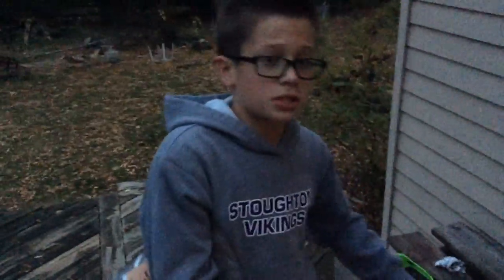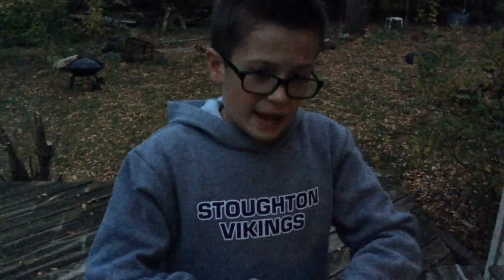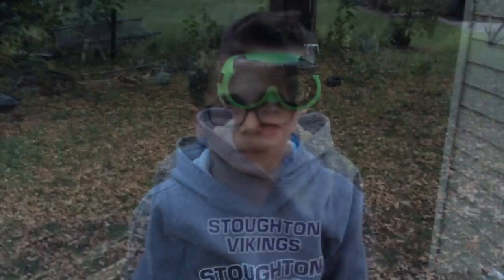And then if you didn't know this, iron in its natural state is red, even though like cast iron you see is like silver. Because as you can see, it's completely red, because the bag is coated with it. So I'm going to make a composition for my reaction, and then I'm going to put a magnesium strip in it, because that's the amount of heat I need to debond the atoms, because that burns at about 3,000 degrees, and that's around where the heat that I need it to be to start the reaction.